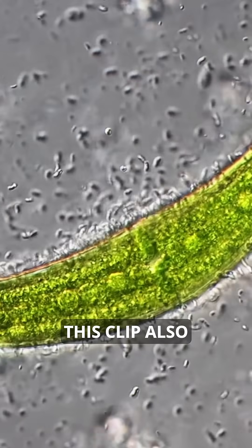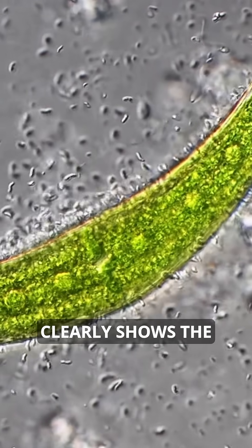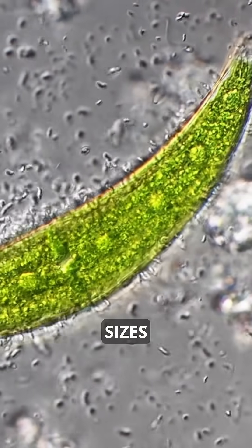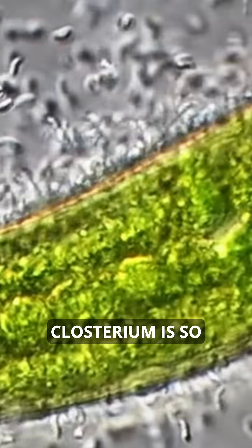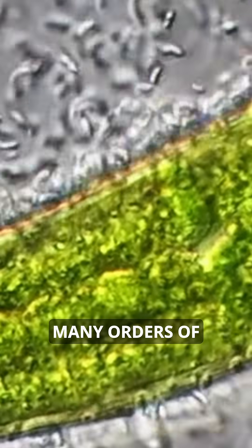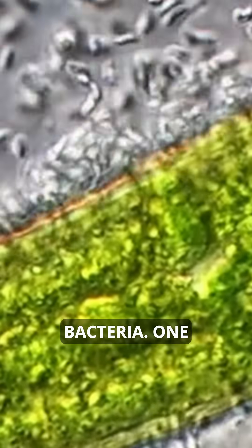I consider this clip also quite interesting because it clearly shows the different cell sizes between the algae and the bacteria, because the Closterium is so many orders of magnitude larger than the surrounding bacteria.